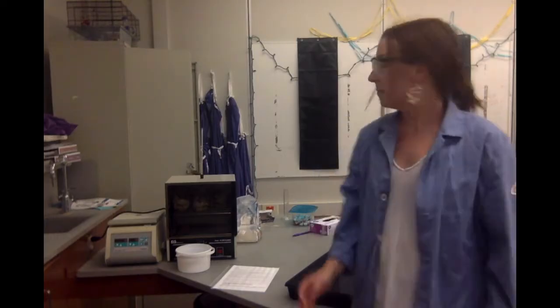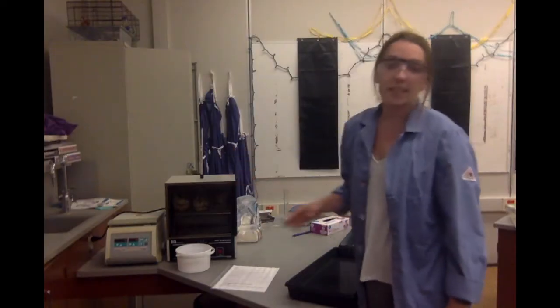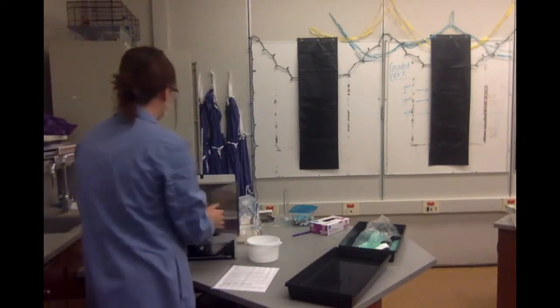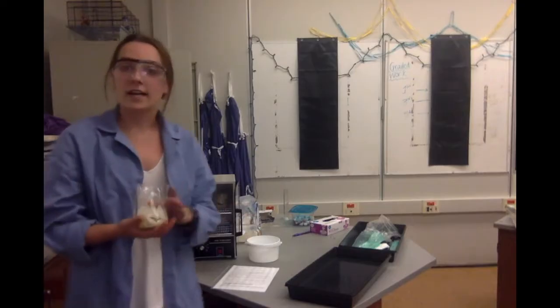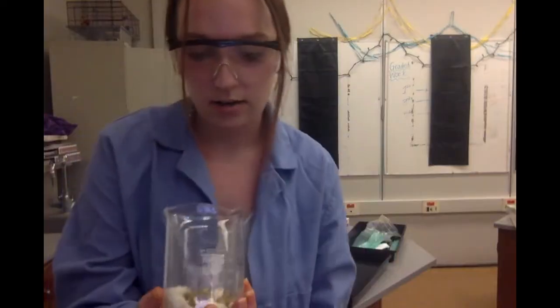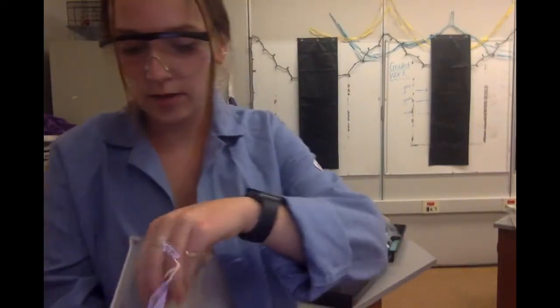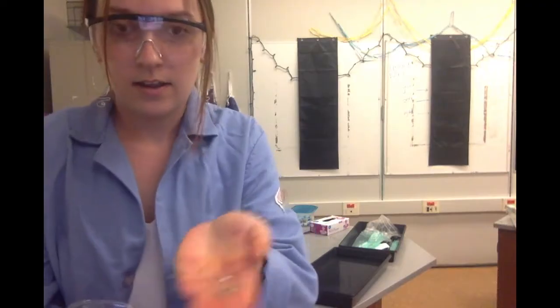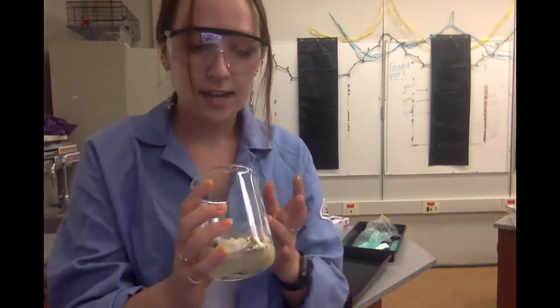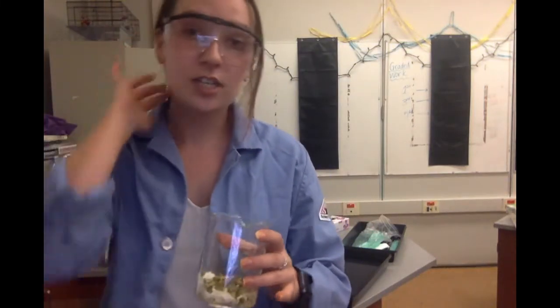What we have set up so far — I've been germinating some different peas, seeds, and beans in an incubator so that they would begin germinating, meaning they're starting to sprout. We can actually see here in our beaker that some are beginning to sprout. We're going to test if the species or type is going to impact their rate of cellular respiration.